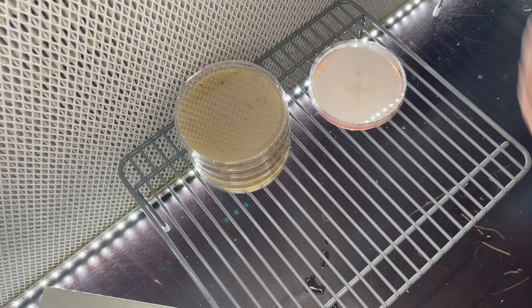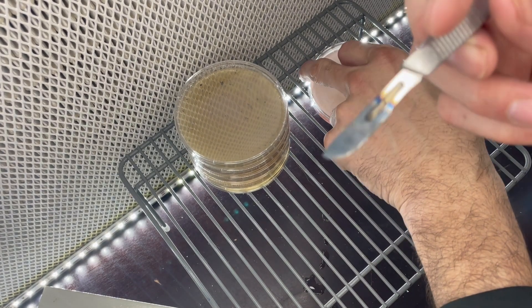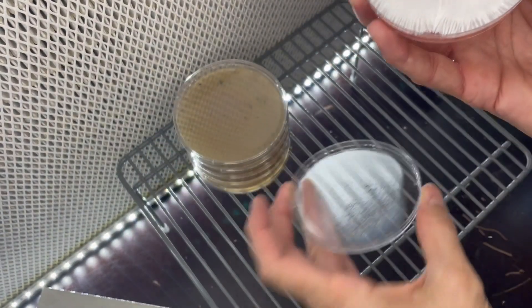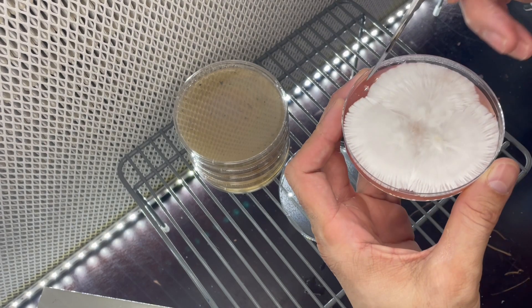Put that out to the side. So first thing we want to do is just take our scalpel and we're just going to cool it down. Just on an outside piece of agar right here. So we'll just cool it right down.